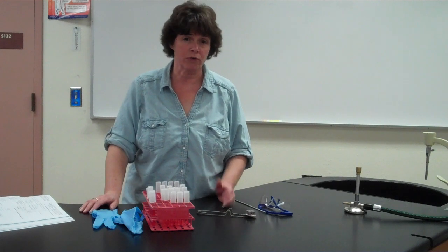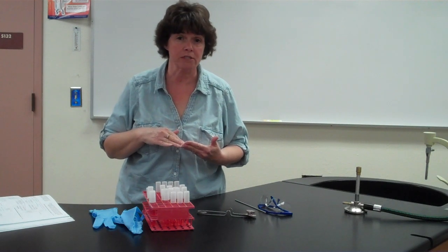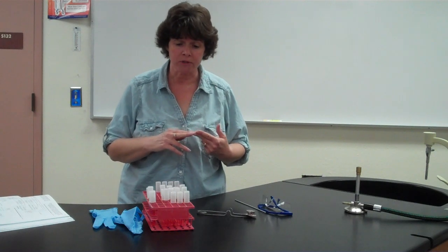So when we talk about fermentation, recall that fermentation uses organic molecules to reduce the hydrogen ions and the electrons that are at the end of glycolysis. And also recall that it doesn't go into the Krebs cycle and it doesn't go into the electron transport chain. With fermentation, the end products are either going to be an alcohol, an acid, and possibly gas. In the test that we're doing today, we're looking specifically at the presence of acid and the presence of gas.